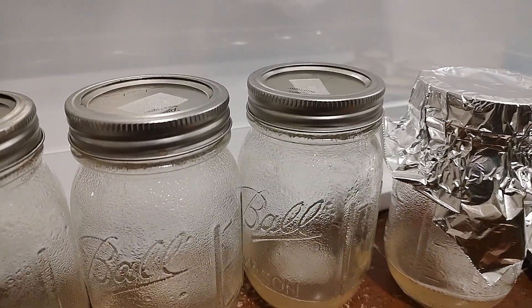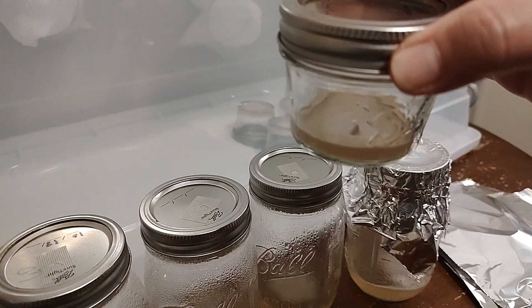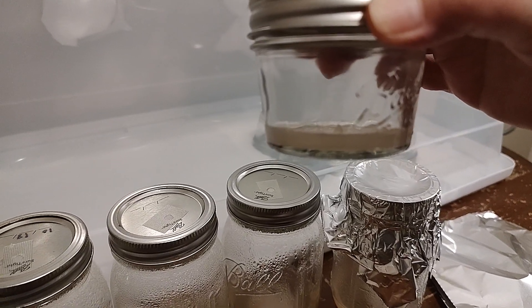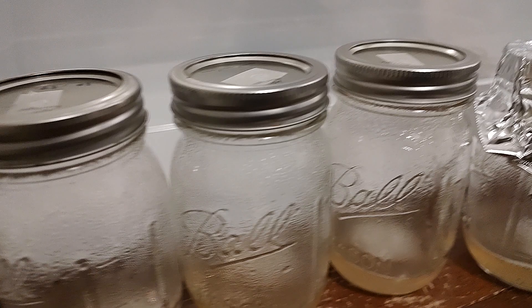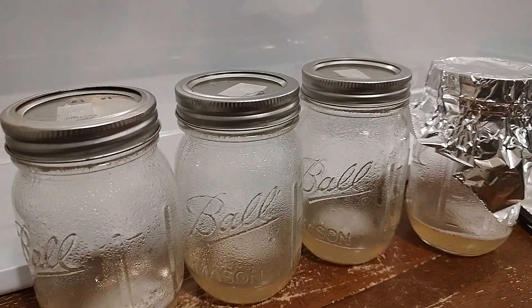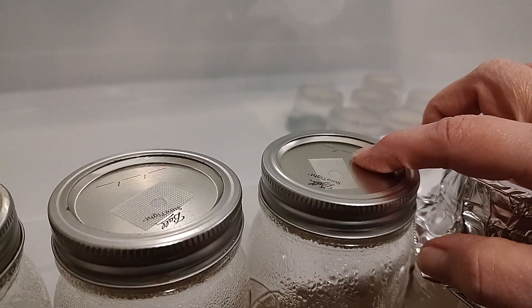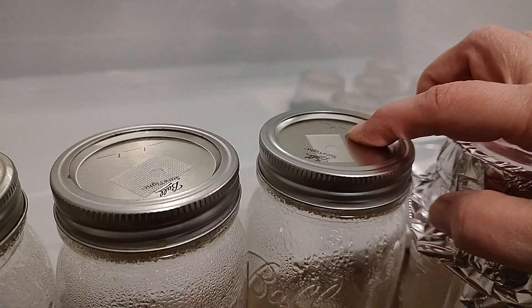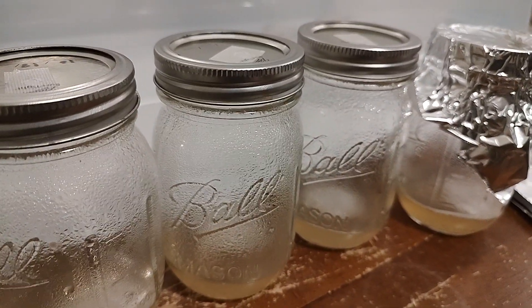Normally we recommend for these no-pour jars 20, max 30 minutes at 15 psi. But the recommendation on Willie's slurry recipe is 45 minutes — and we're not following it exactly because we do not have syringe ports. That's unnecessary to us.